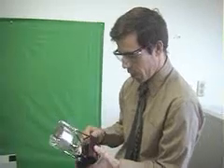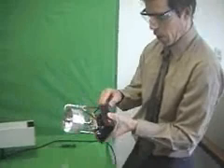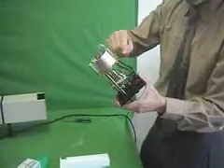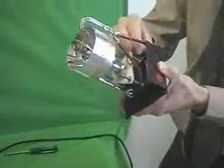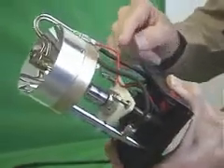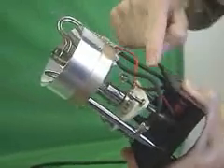Make sure that none of the wires or anything are outside the edge of it. Just tuck the rubber tubes, which are cooling. The 75 watt xenon lamp does not require water cooling. The tubes are just set there for general purpose, for any kind of lamp. Just tuck them in, make sure this wire is in there.